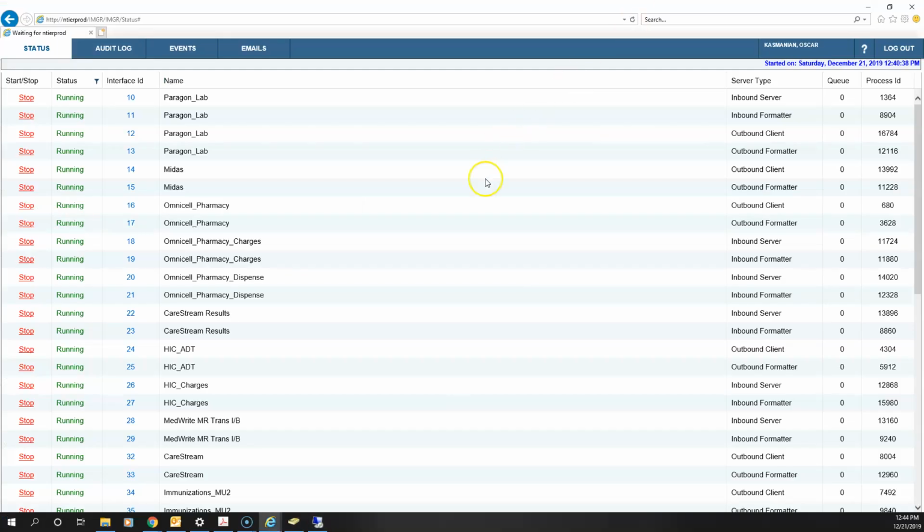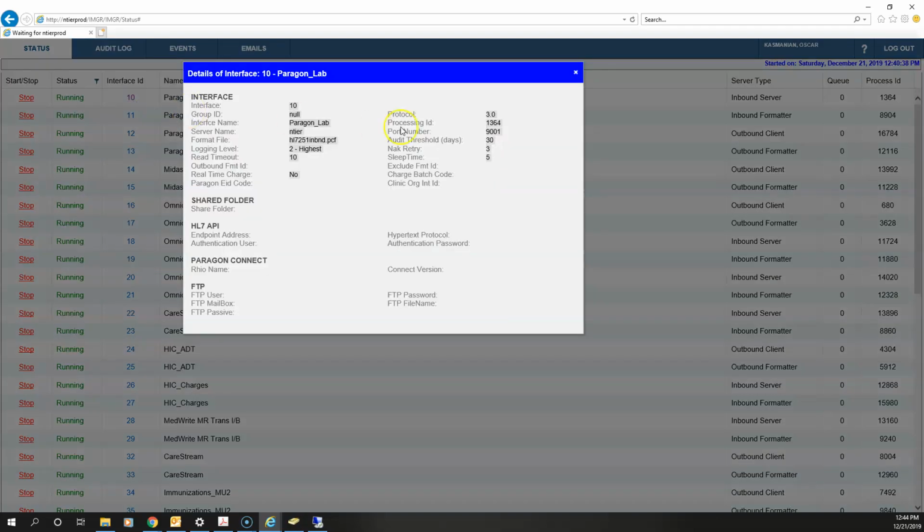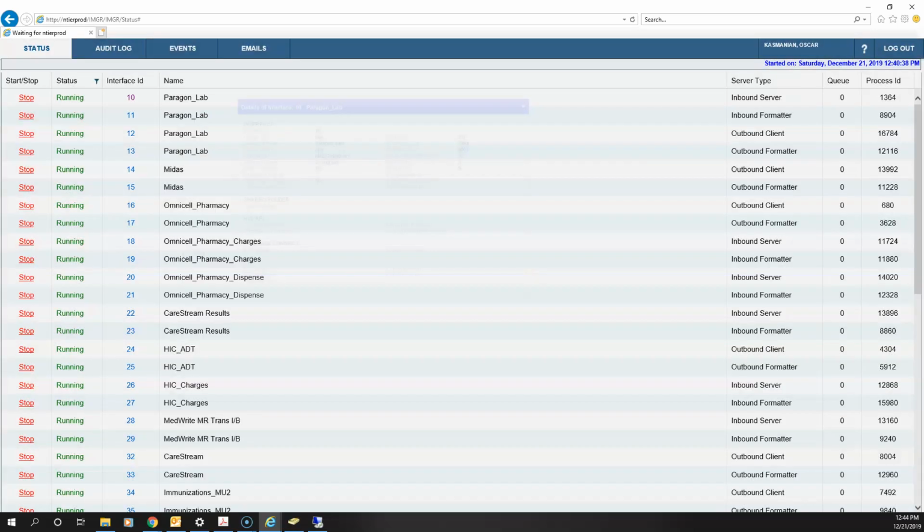Then we minimize this, so we're back to the interface manager. So we did the outbound, the 12 and 13, interface 12 and 13. And now we're doing 10 and 11. So this is coming in. Okay, so orders go out, results come in. If we look here for the details of the interface, bam, look at that, 9001, big surprise. If we look here and we see the queue is stopped up, just the same thing, stop and start this service here. This interface here to get the items to process.